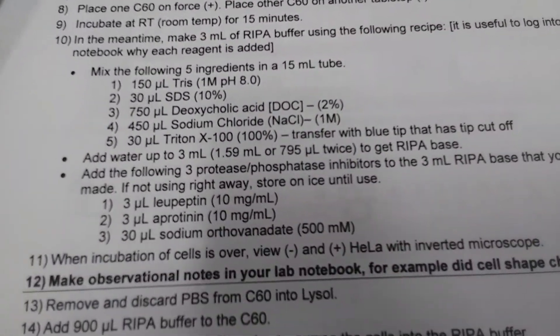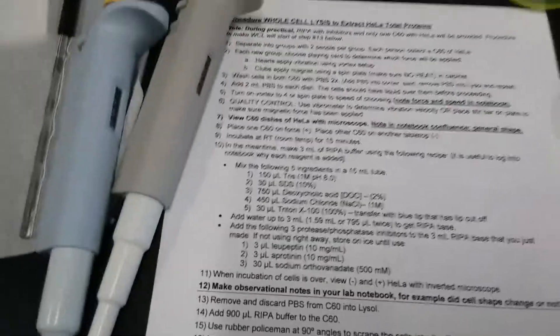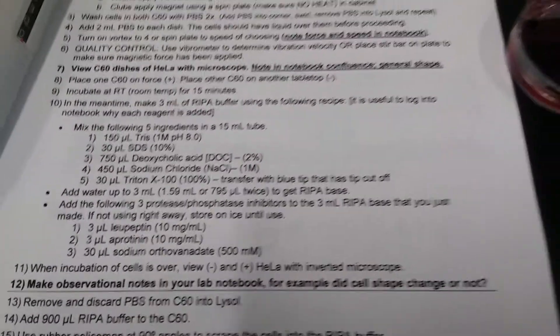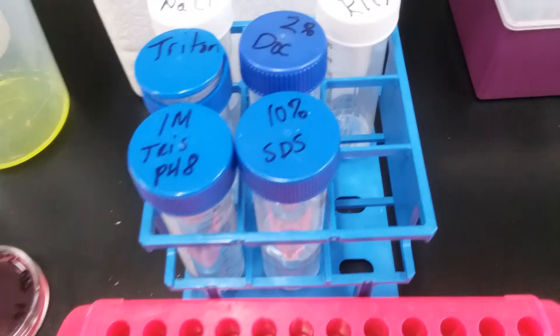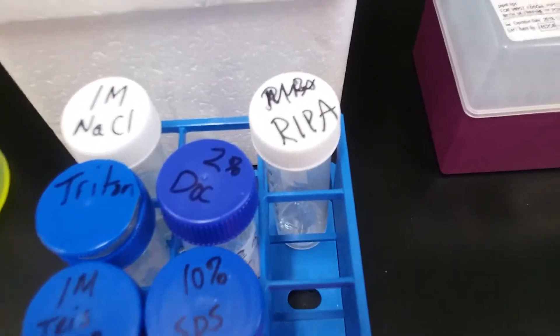This is our recipe and we're simply going to use our pipette men with tips to transfer these particular chemicals into the RIPA tube.